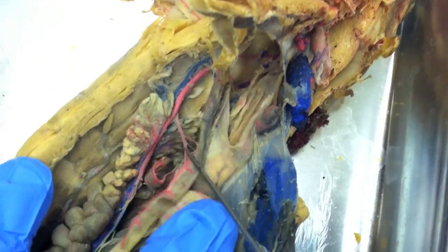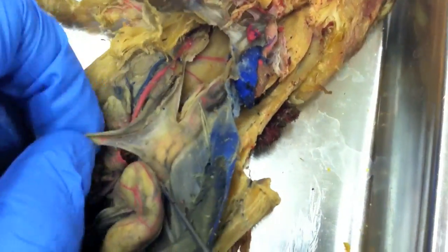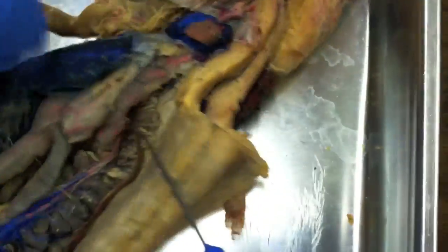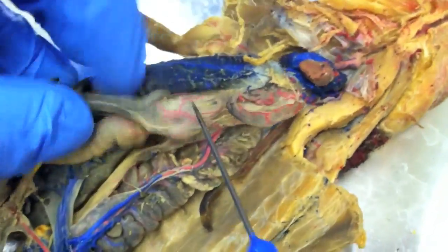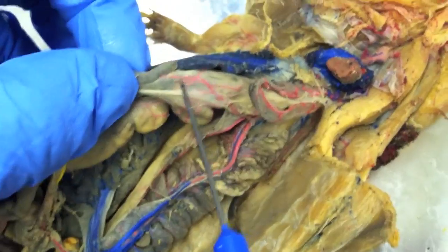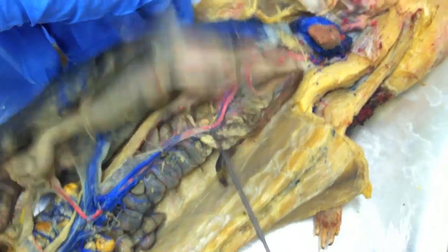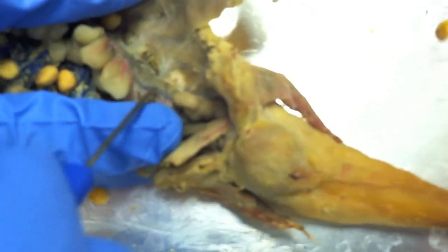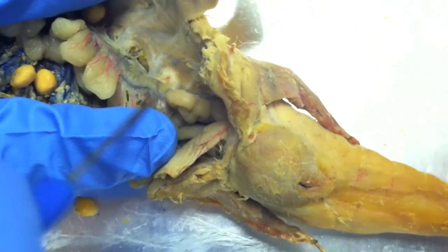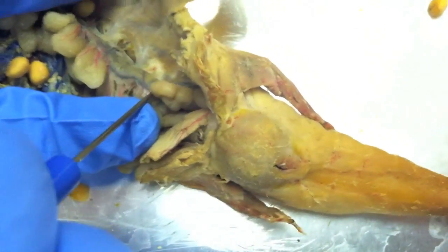Dorsal aorta — the first branch up here is your gastric. Your gastric goes right up to the stomach and then continues on as the splenic, the anterior splenic. This dark structure is the kidney, and the dark one on top is the renal portal vein.